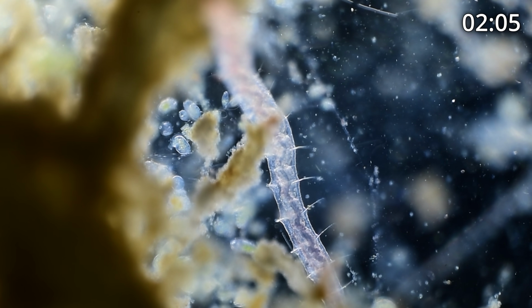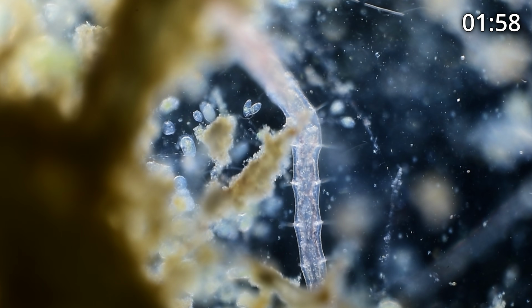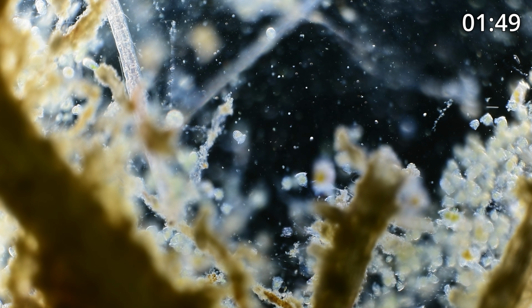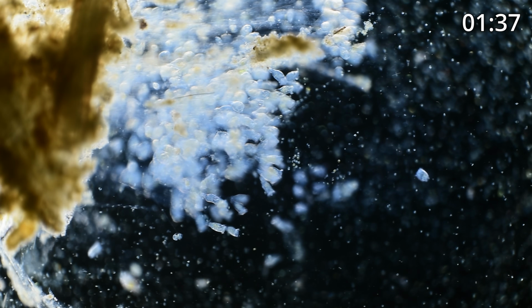There's a big worm. You can see an annelid, and you can see the setae, the hairs, fibers sticking out from each side to kind of delineate where each segment of the worm is. We're down to about 2 minutes left. These 10-minute looks go pretty quickly. But God, it's just so overwhelming, the amount of life that we see. Absolutely amazing.